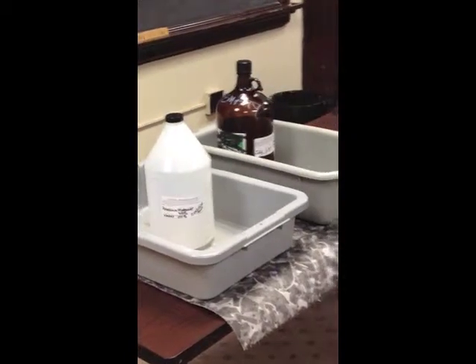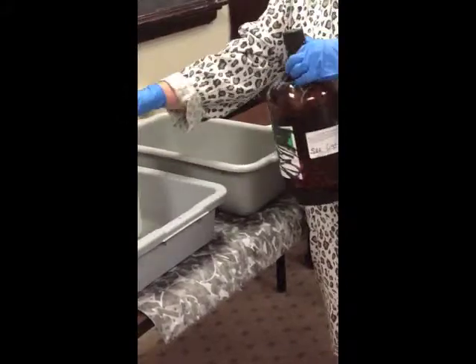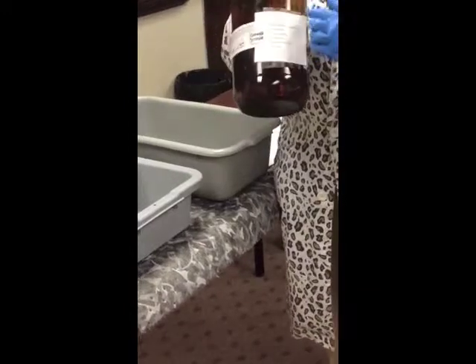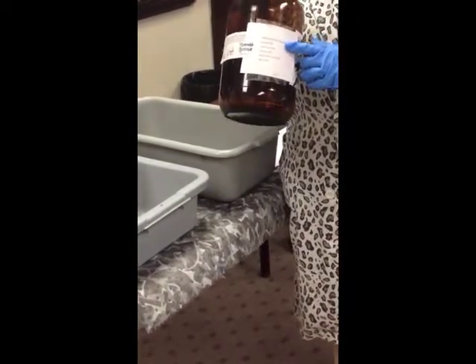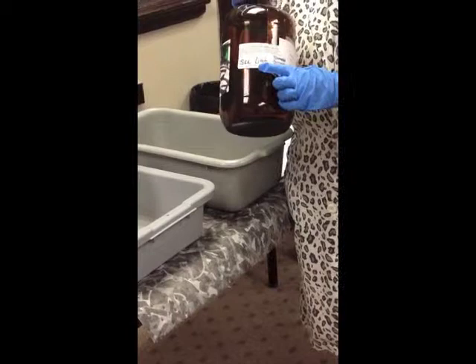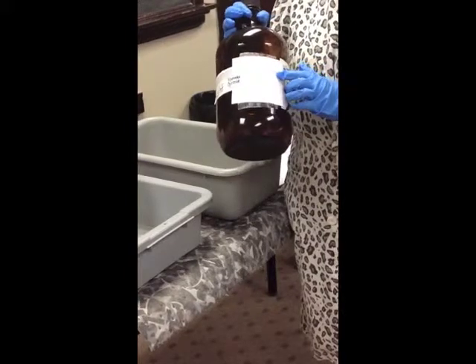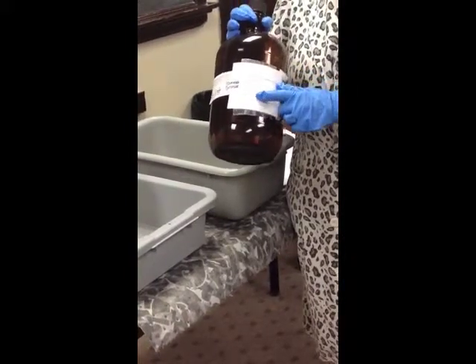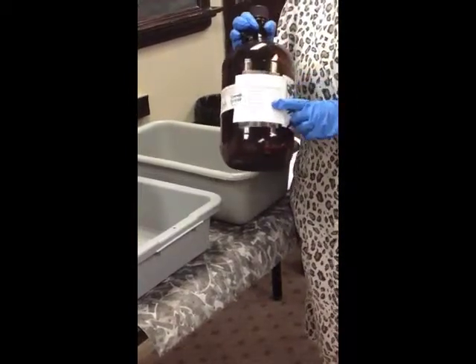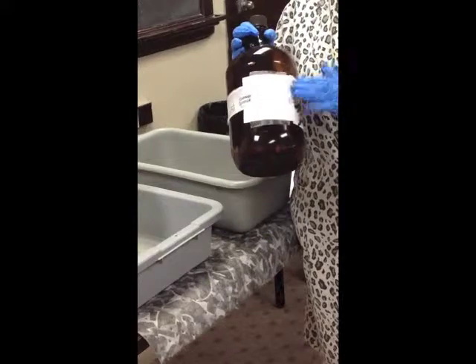Now, if your constituents are too many to list on this label, then you're more than welcome to print out another piece of paper or write those constituents on the container. The way you would do that is you attach your hazardous waste label, where it says chemical name, mark see list, and then over here we have our list. This is a hazardous waste flammable acidic solution and our constituents: the acetone, acetic acid, toluene, hydrofluoric, and water. And we put our percentages. If you know your percentages, that helps us out greatly when we're determining how this product needs to ship.